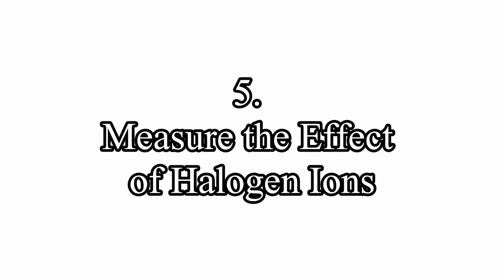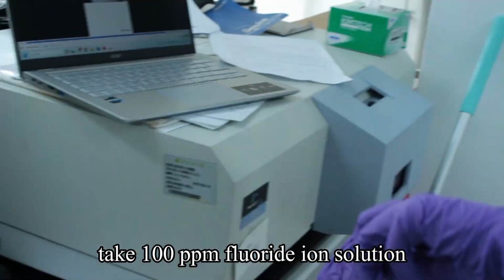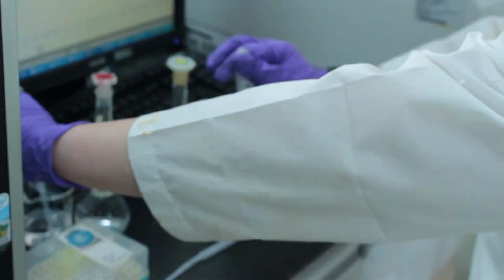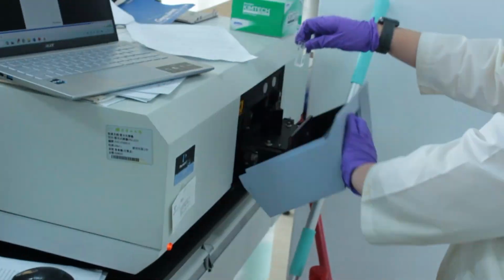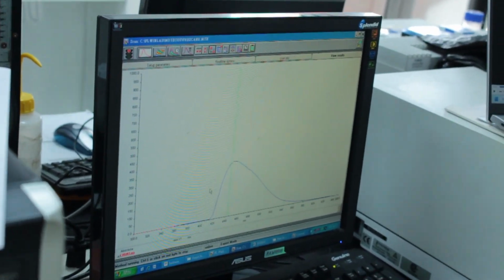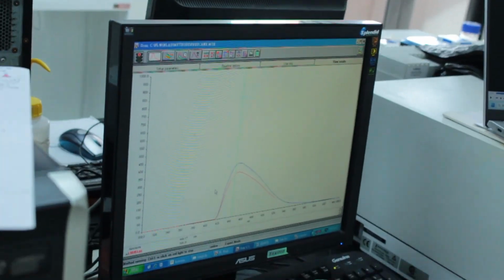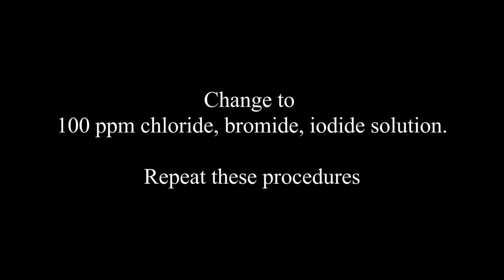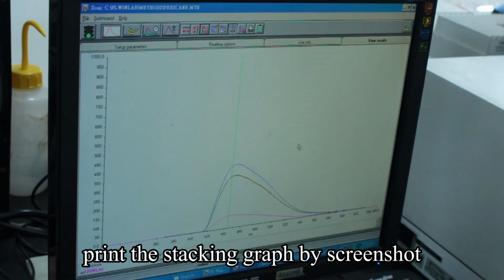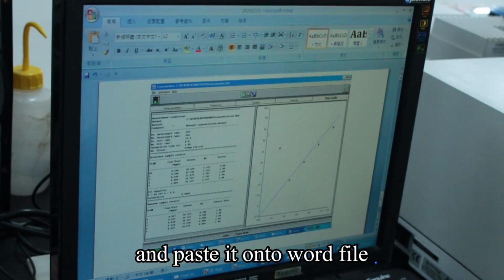Step 5. Measure the effect of halogen ions. Take 100 ppm fluoride ion solution, rinse the cuvette with it, and then measure it. Change to 100 ppm chloride, bromide, and iodide solutions, and repeat these procedures. After finishing all the measurements, print the stacking graph by screenshot, and paste it onto a Word file.